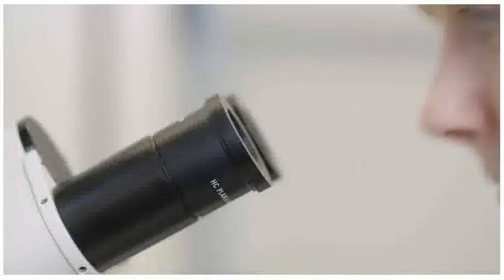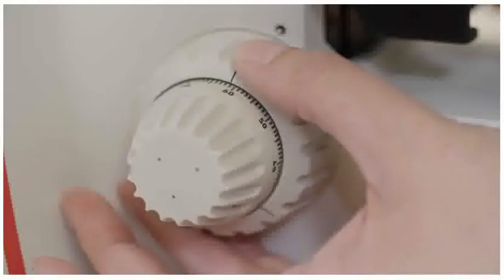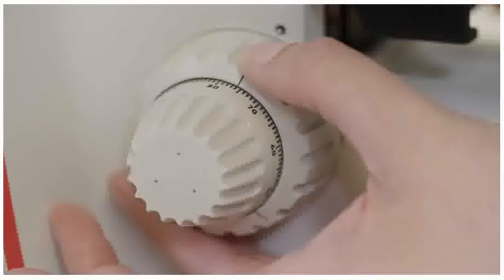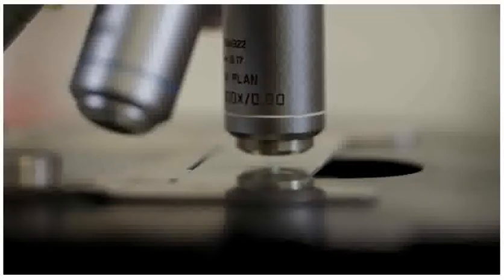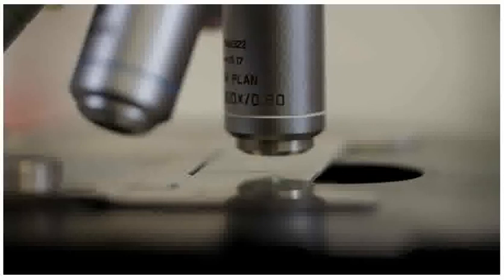Whilst looking down the eyepiece, the focusing dial is gently turned in the other direction so that the stage moves away from the objective lens until the slide comes into focus.